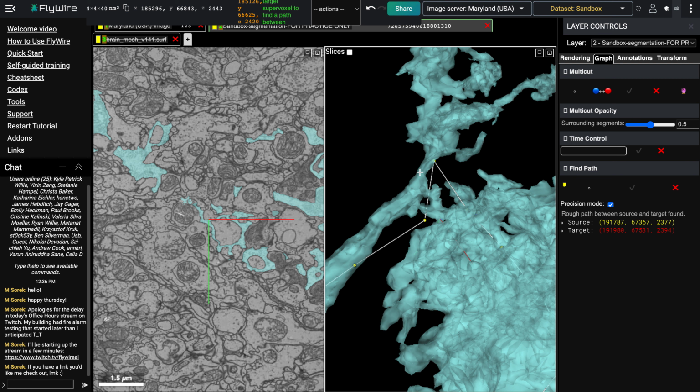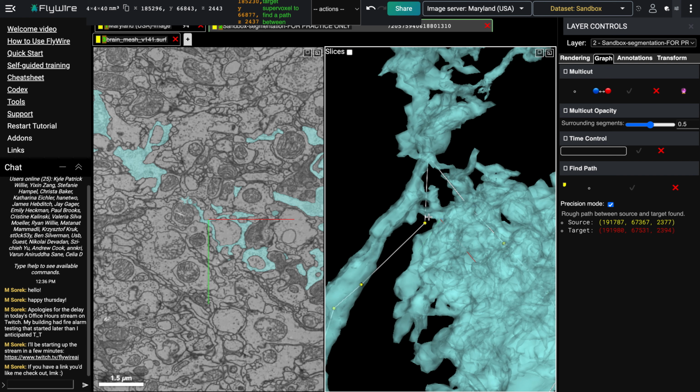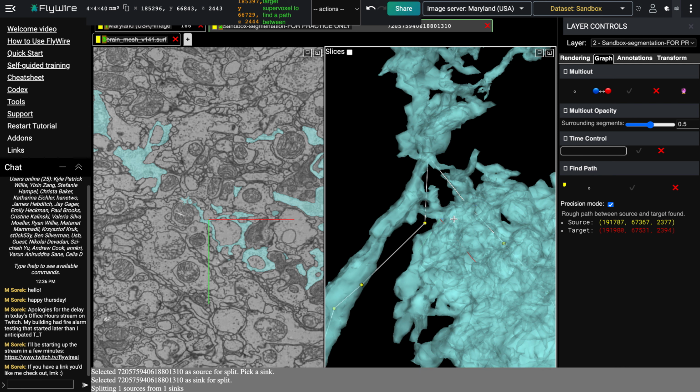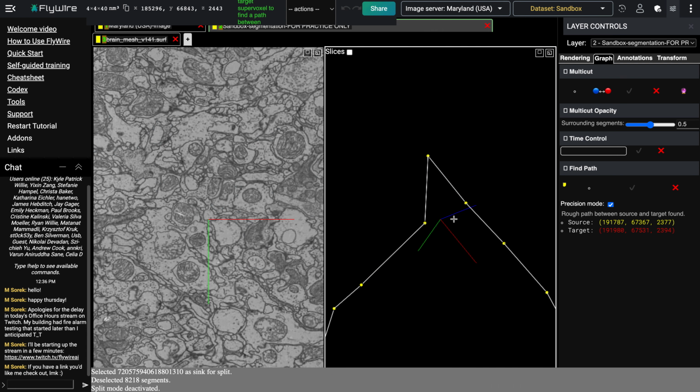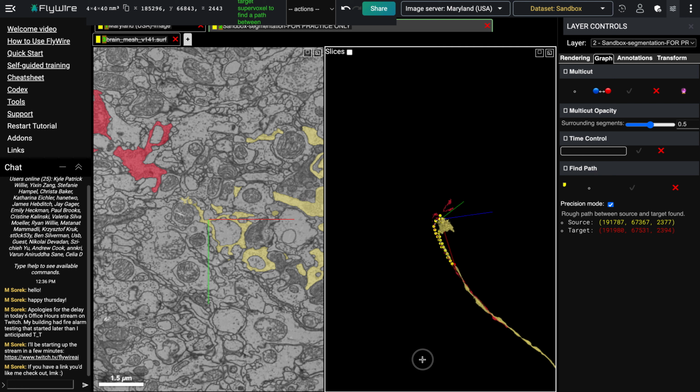So for this one, since it's a pretty small bridge between the two neurons, I'm probably just going to use a regular cut, C, to try and disconnect them. If it was a larger area of connection, I would use multi-cut, but right now I'm just going to use C, click on one, click on the other one, and then wait. Alright, and there we go.